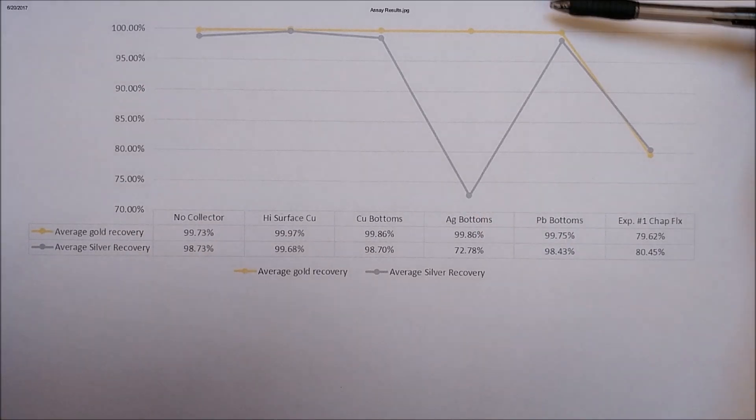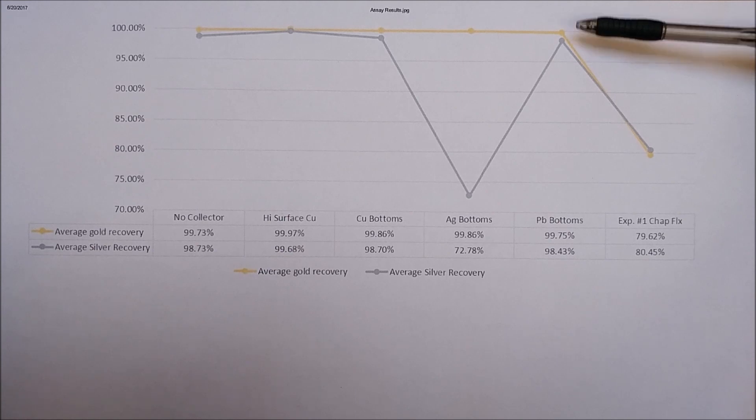The lead again did about as equal with the other, the copper and then no collector.